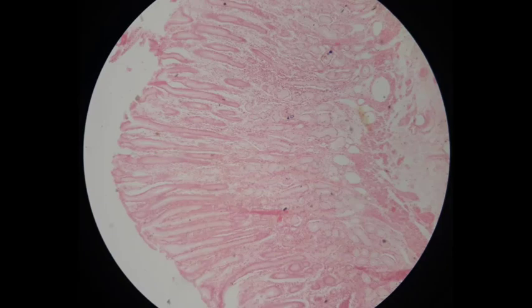Now, let me locate the elements of the mucosa. One of the best ways to distinguish between the two organs of the digestive system is to examine the surface epithelium that lines the pits or villi. Here you can find a simple columnar epithelium. It's specialized for secretion. The gastric mucosa contains gastric pits, which are surface invaginations that also serve as the ducts of the underlying gastric glands.